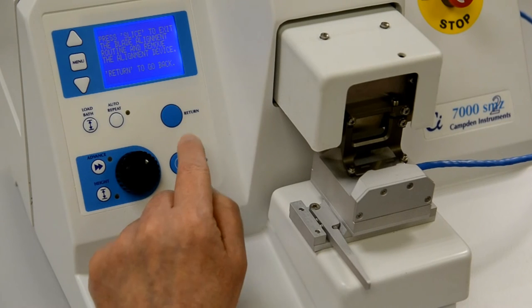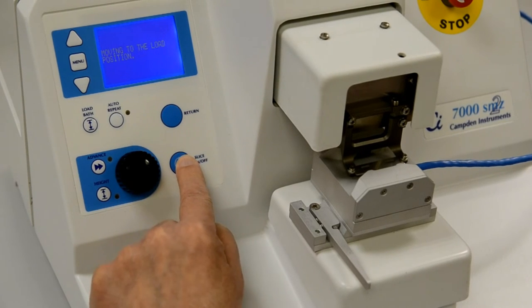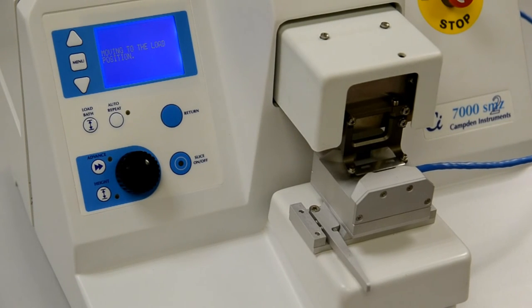Once you have completed the alignment procedure, press the return key and follow the on-screen instructions.